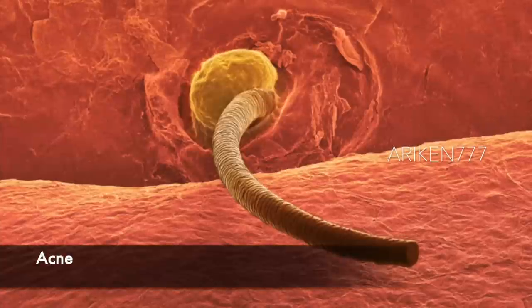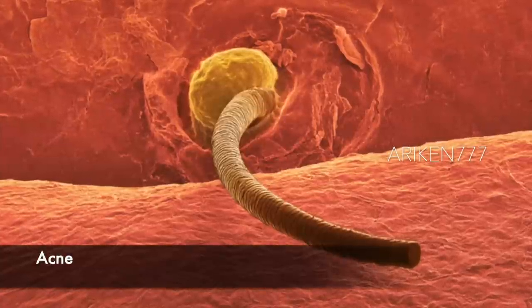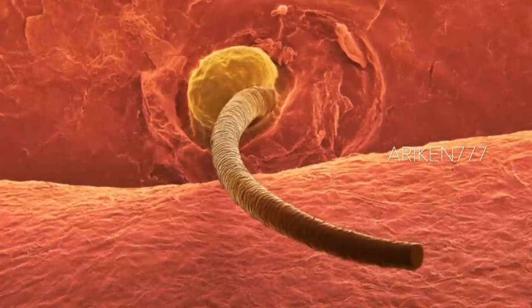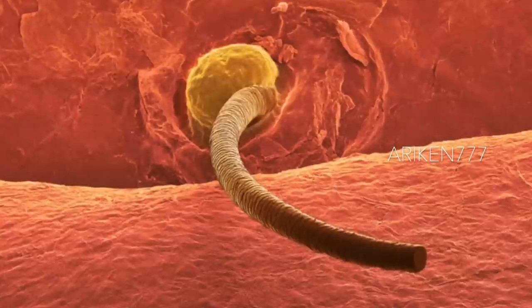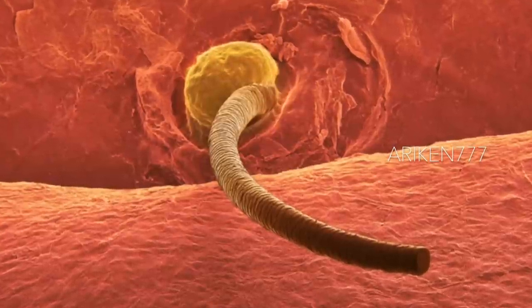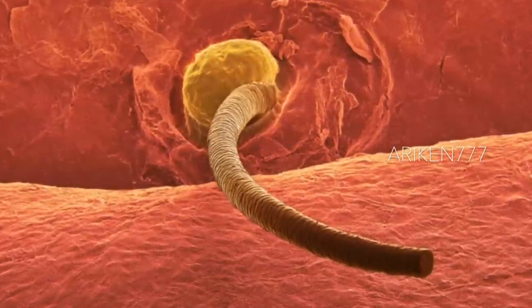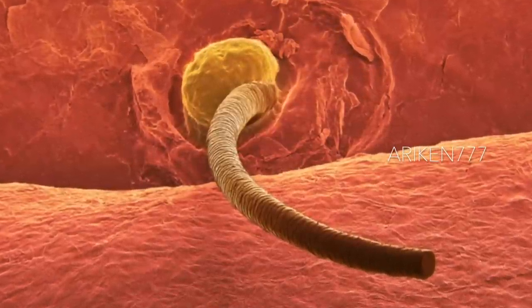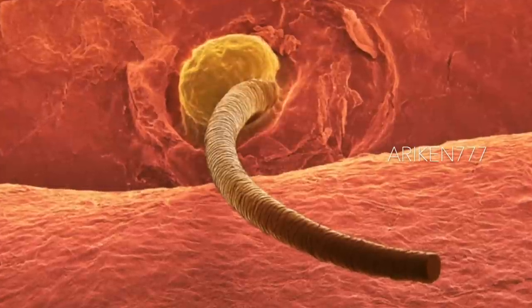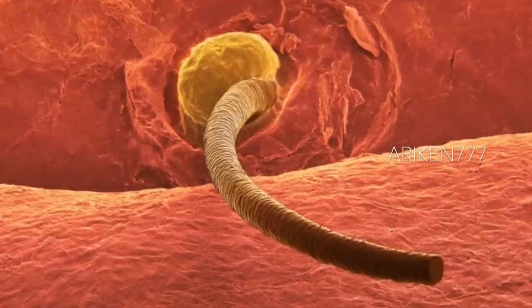This image shows sebum, a natural oily substance produced by a sebaceous gland attached to the hair follicle. The sebum can be seen at the base of hair in yellow color on the surface of the skin. Acne is a skin condition that occurs when dead skin cells and sebum clog hair follicles.